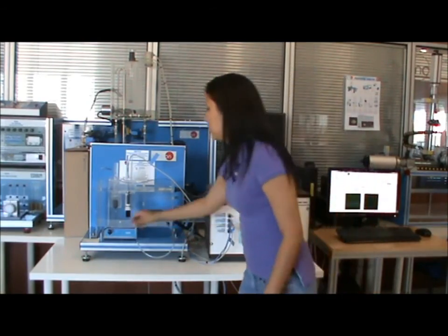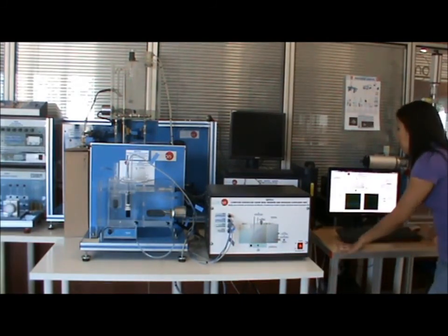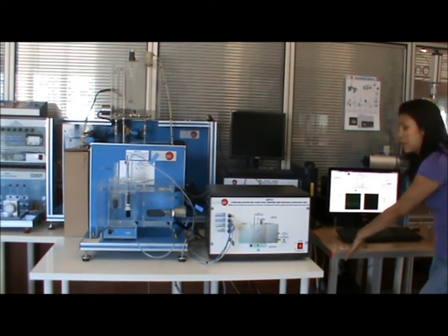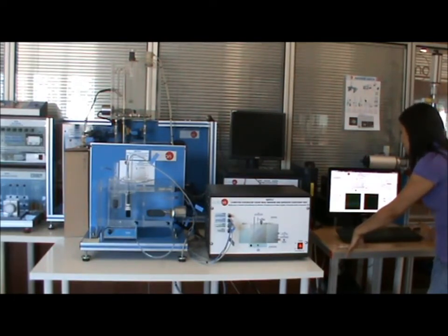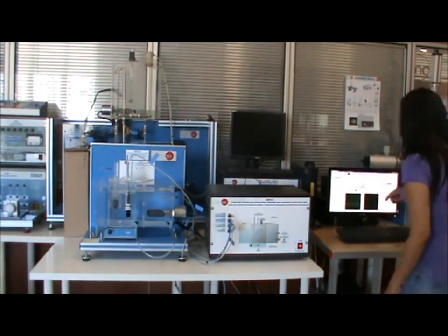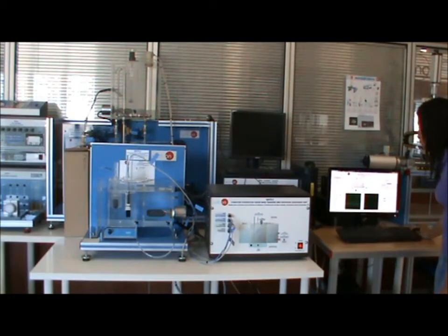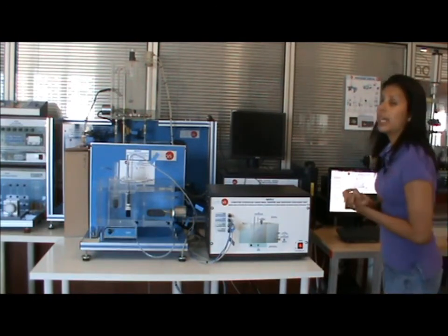Once that is done, you are going to start the software and begin the experiment. You're going to click start. You're going to set the temperature of the resistance that is down here to 20. And you're going to check the mark that says PID on AR1 ST1 set point. Click start. Choose graph A, ST1, ST2, SCC1, and now you have to wait a couple hours for the experiment to be done.